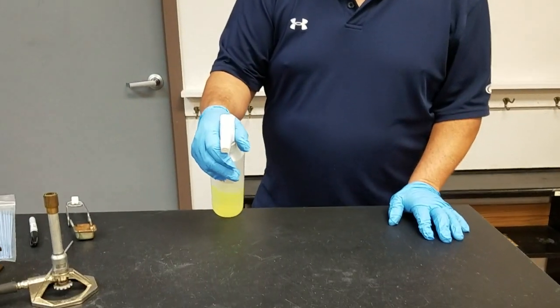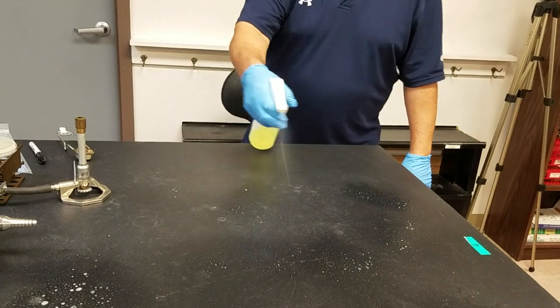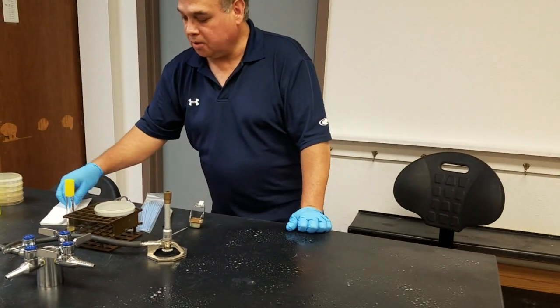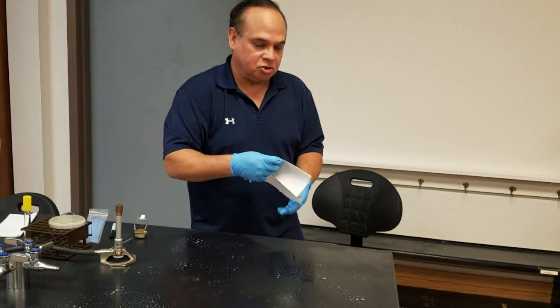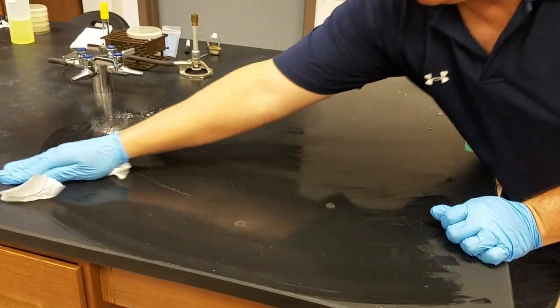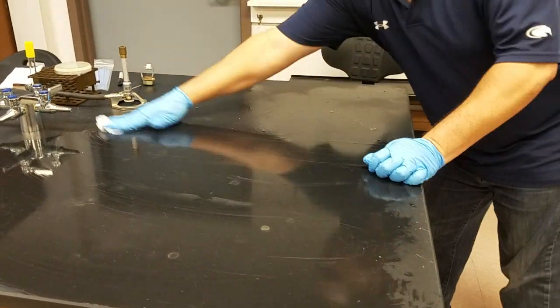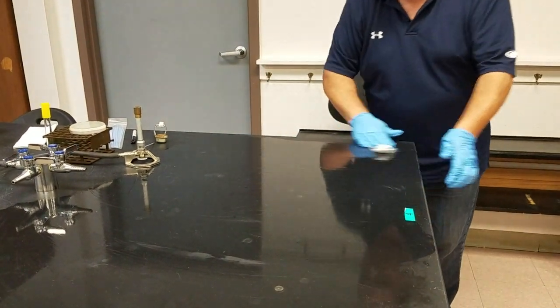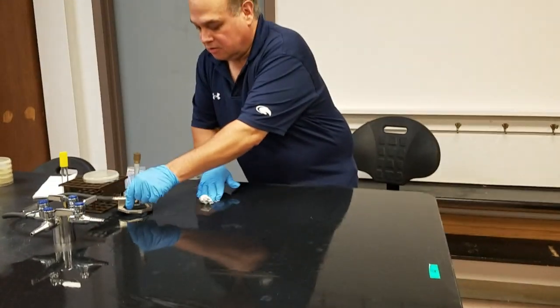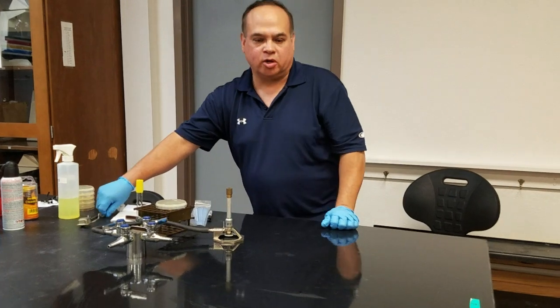Before we get started, I'm going to sanitize the entire table by laying down disinfectant - 10% Lysol, which we use in our laboratory. In microbiology we clean to cover, not to dry. We want to cover the entire surface area because one of the most important things about working with microbes is proper contact time - the amount of time it takes for a disinfectant or antiseptic to come in contact with the microorganism to render it inactive or kill it completely. This is disinfected and we can start to set up now.